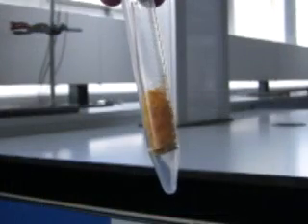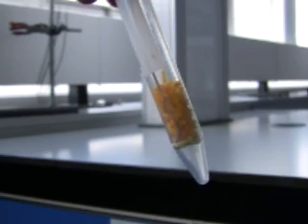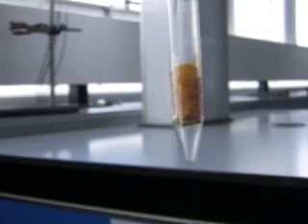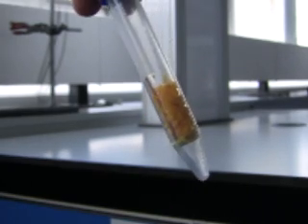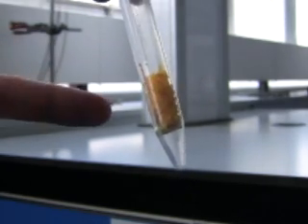In this experiment we're going to look at using liquid carbon dioxide as a solvent for extracting limonene from orange peel, as shown on the screen.